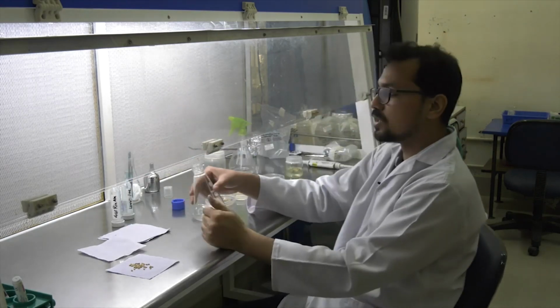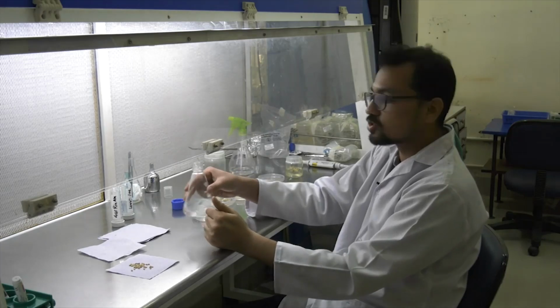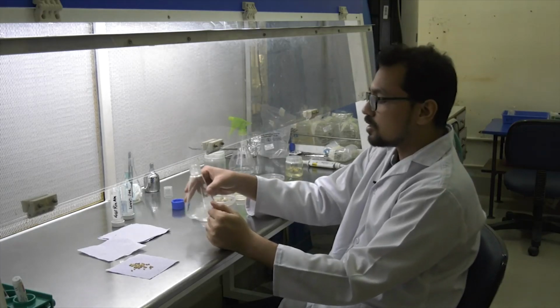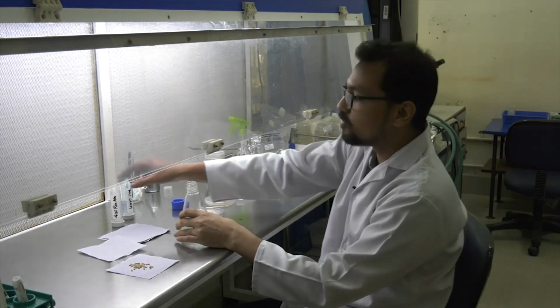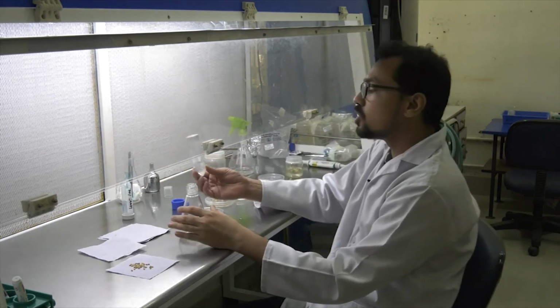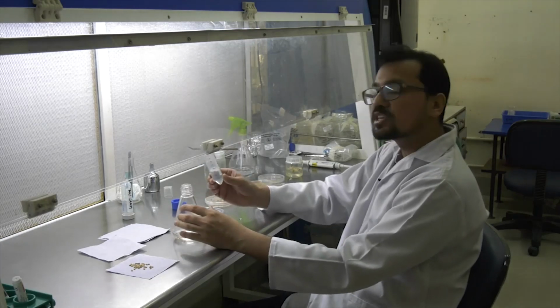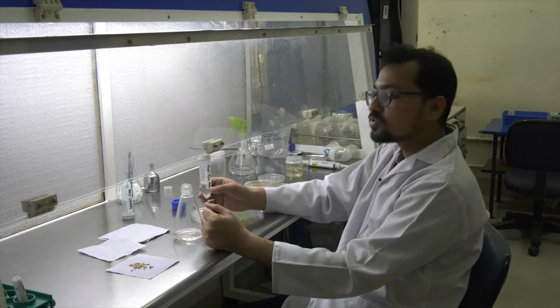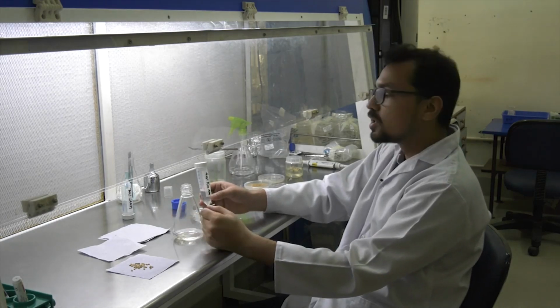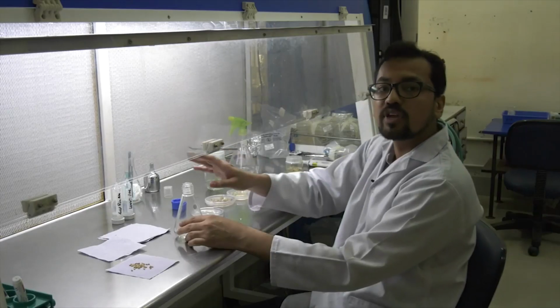This is done for 90 seconds, not more than 90 seconds. Once 90 seconds is complete, then we use Rin-ala, which contains sodium hypochlorite. Some of the other chemical agents used for surface sterilization is HgCl2. In Rin-ala it is done for 15 minutes.